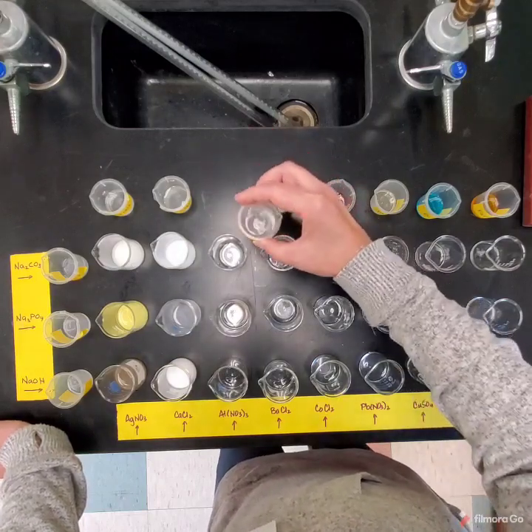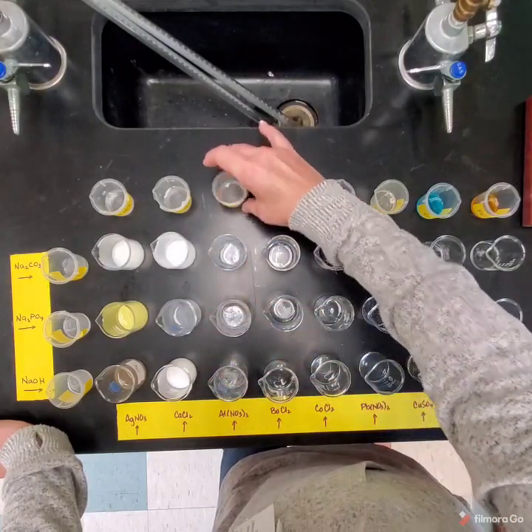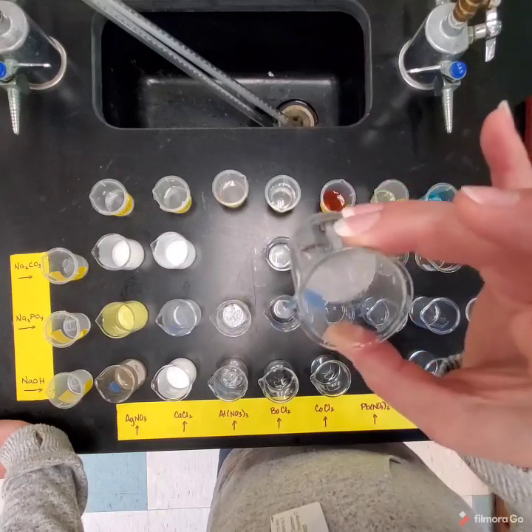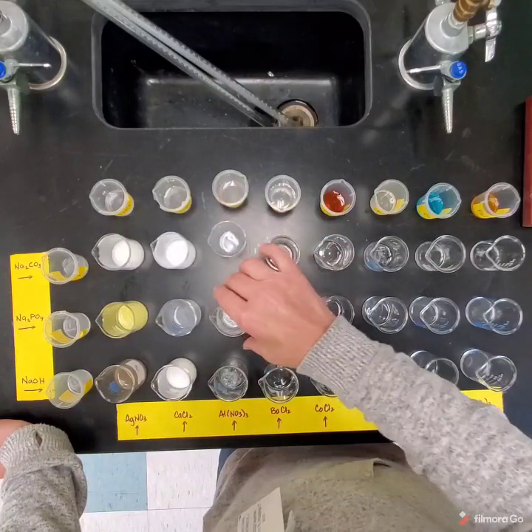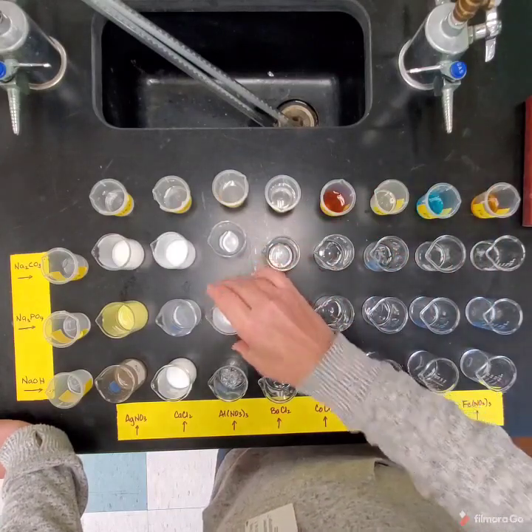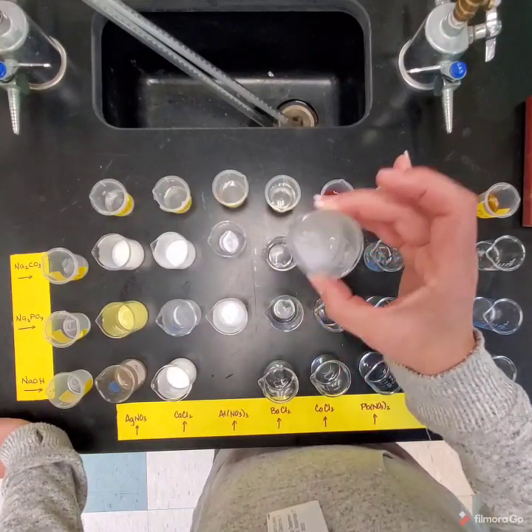All right, this next one is aluminum nitrate that we're adding. Okay, so here is aluminum nitrate and sodium carbonate, and then you can hear there's little bubbles going off as well, which means a gas is being given off in addition to a solid. This one, see how it kind of just immediately gelled up and got goopy? And here's another one that's just kind of goopy. That's the scientific word, goopy.